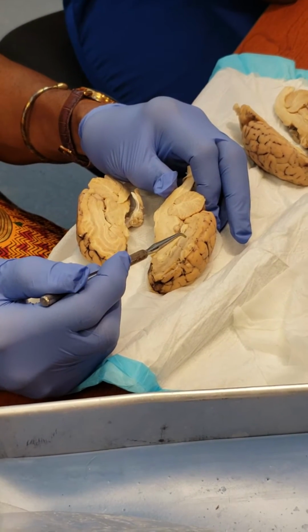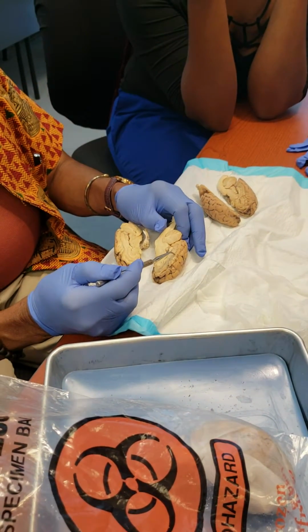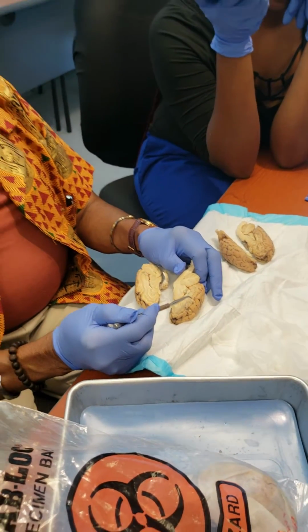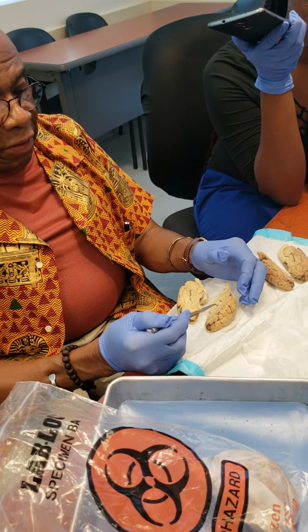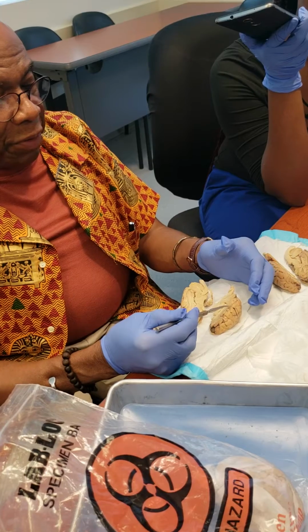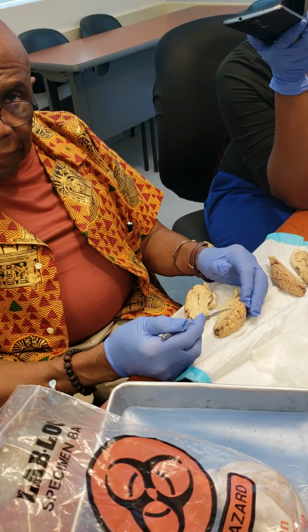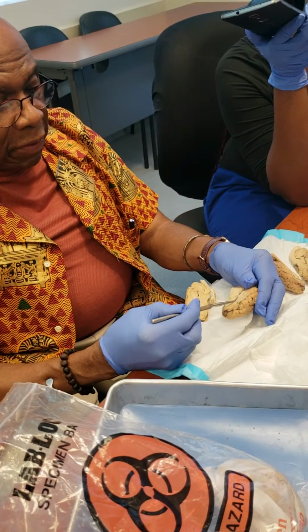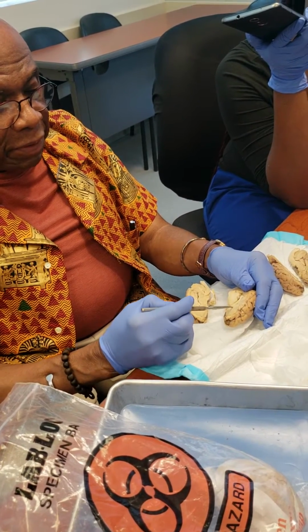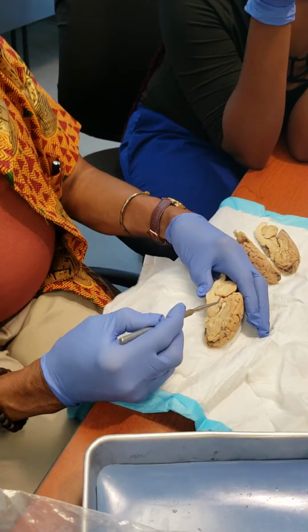So if you're going to have an exam and you cram for the exam, it's not going to be here. You go to sleep and flush it in 36 hours. Yeah. So that knowledge is not going to stay. That's the reason I'm telling you, hey, you don't remember this. You put it in short-term memory. It's going to be gone by the time you really need it to pass your boards. Anyway, so this is the corpus callosum, the septum pellucidum, lateral ventricle, third ventricle.